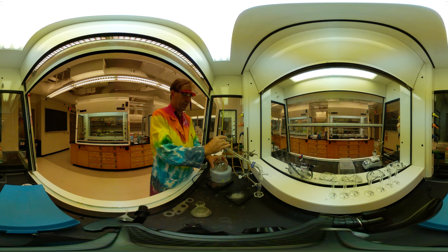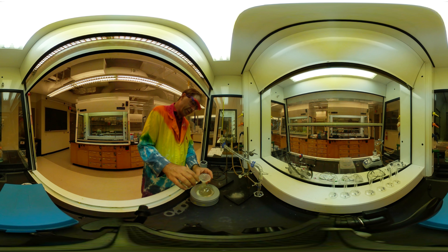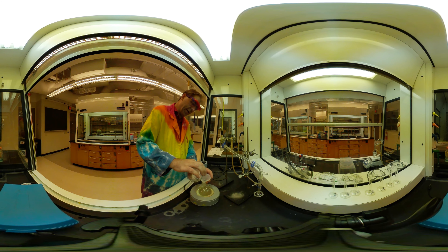Once again, I already took the mass of this — I'm not going through that whole thing this time, just to save some time in the experiment. But this was also a sample of the beet sugar that had been fermented with yeast in tap water and the Pasteur salt solution for 10 days.